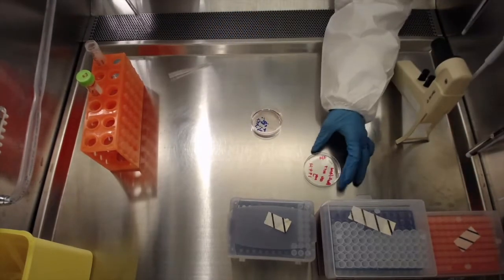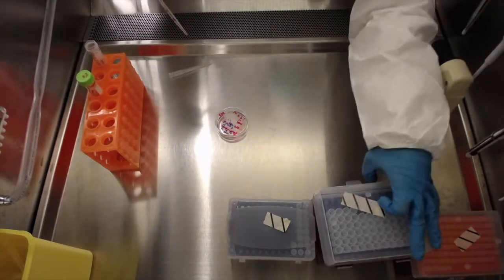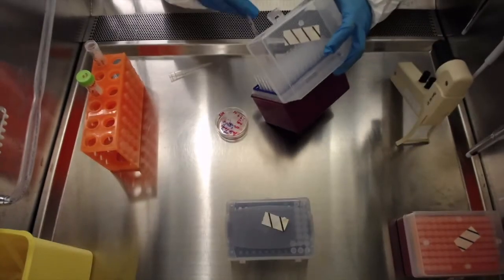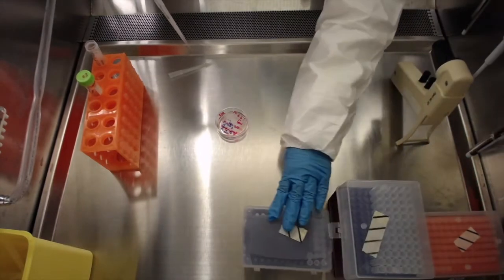In case of a dish with a high percentage of regions of spontaneous differentiation, wash the cells with warm DMEM to eliminate the debris.